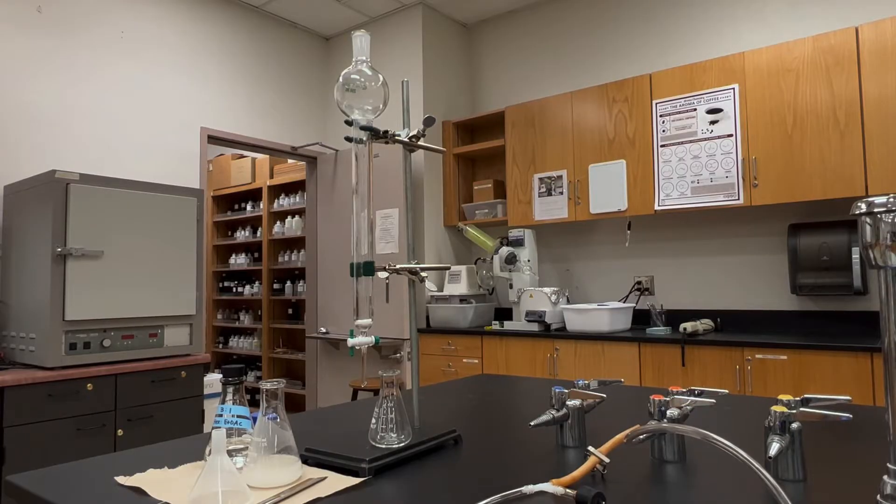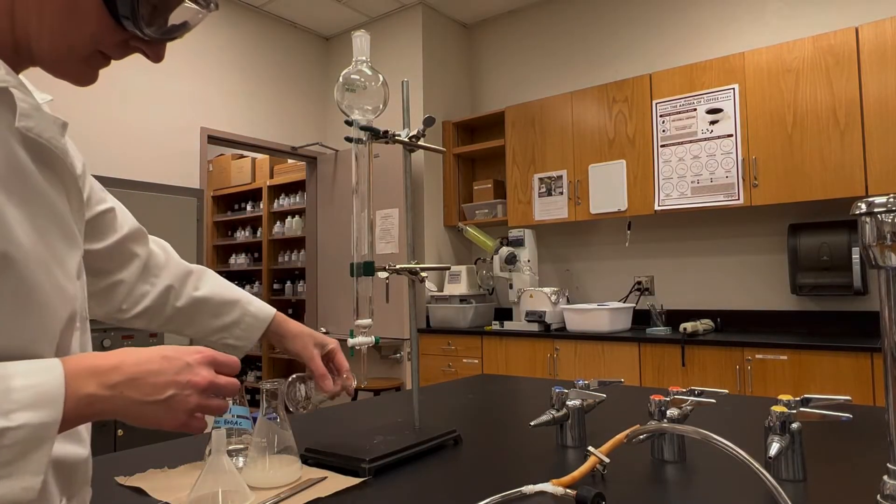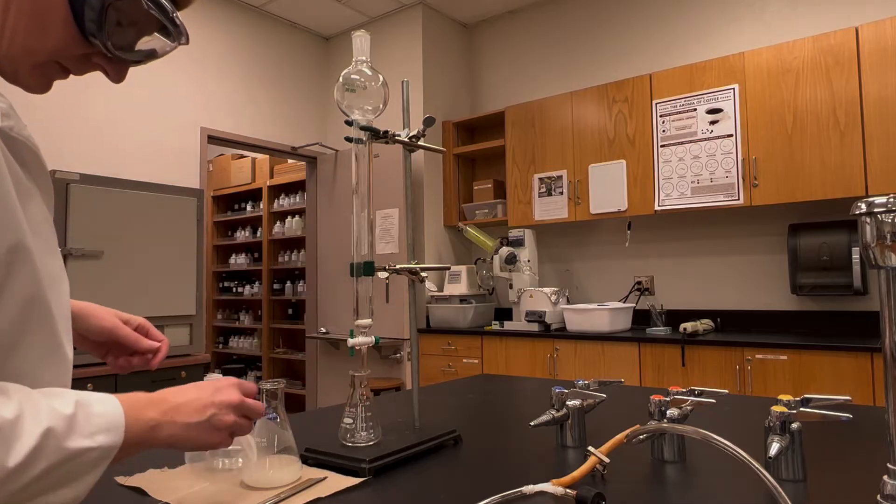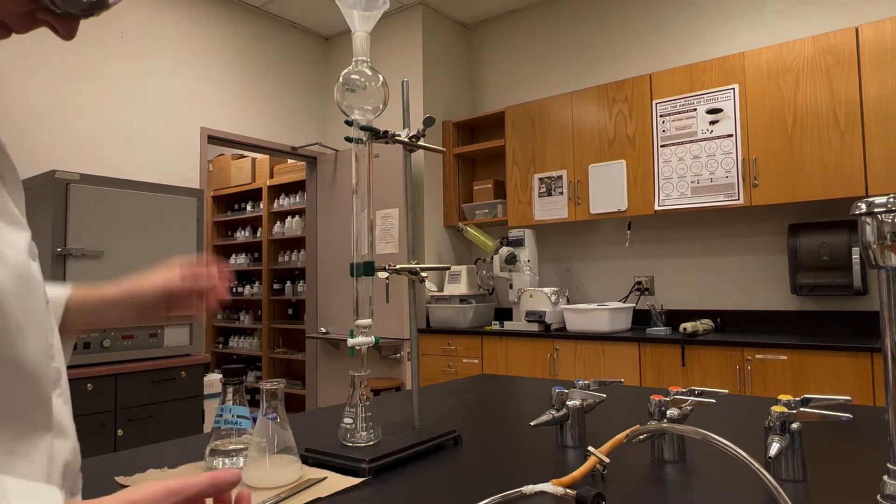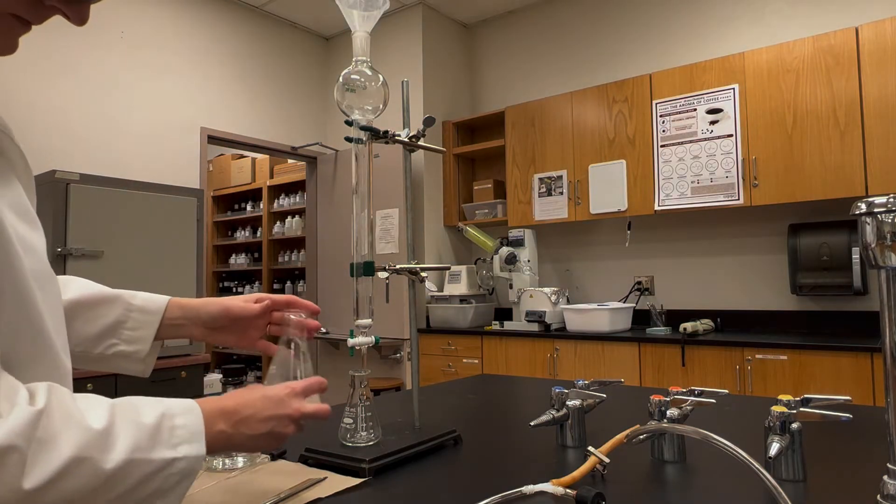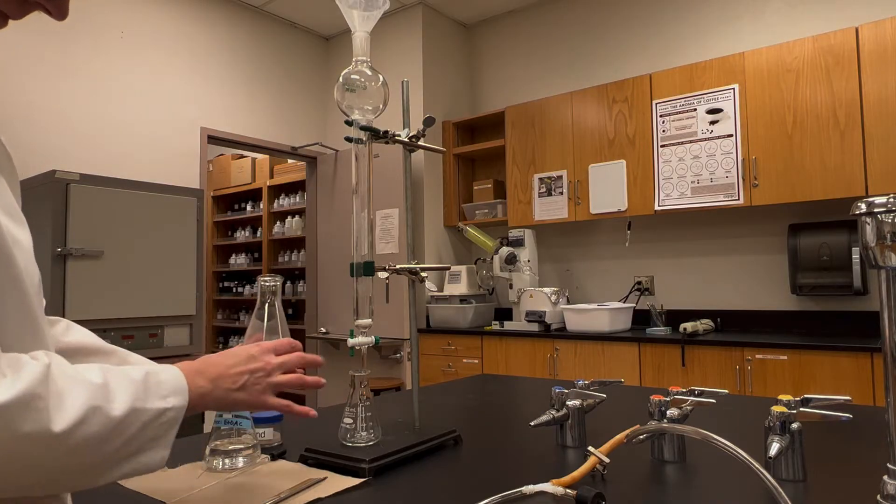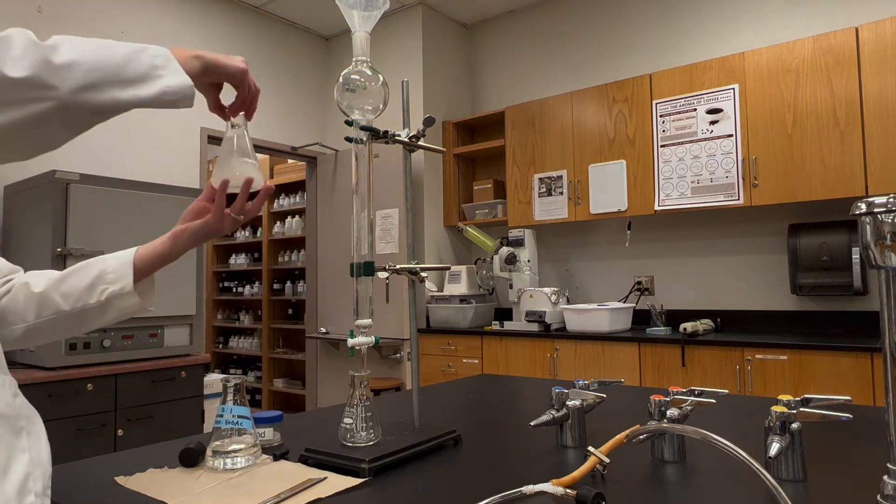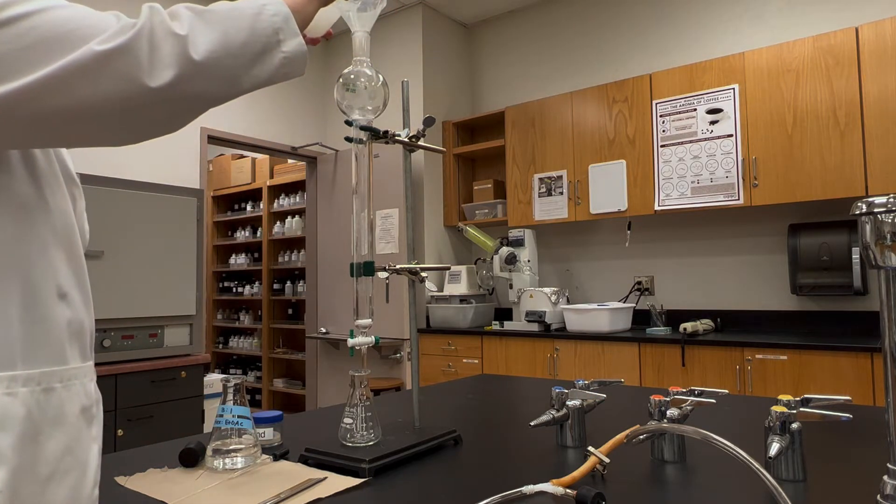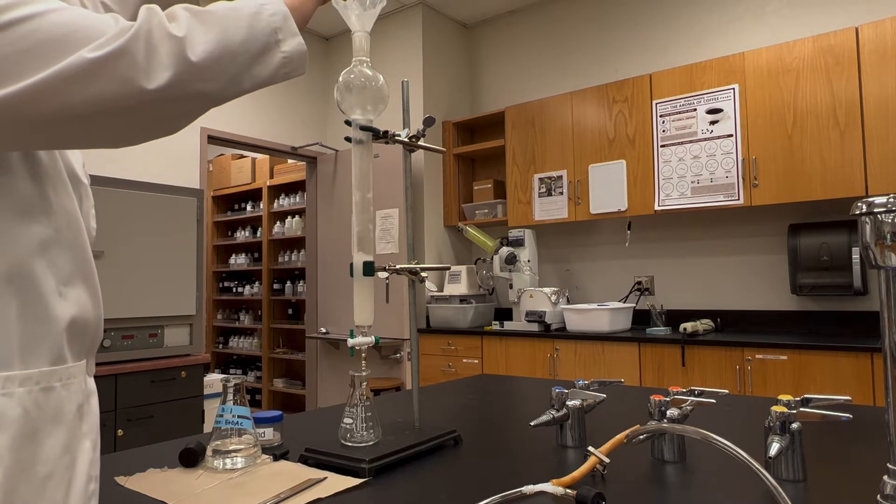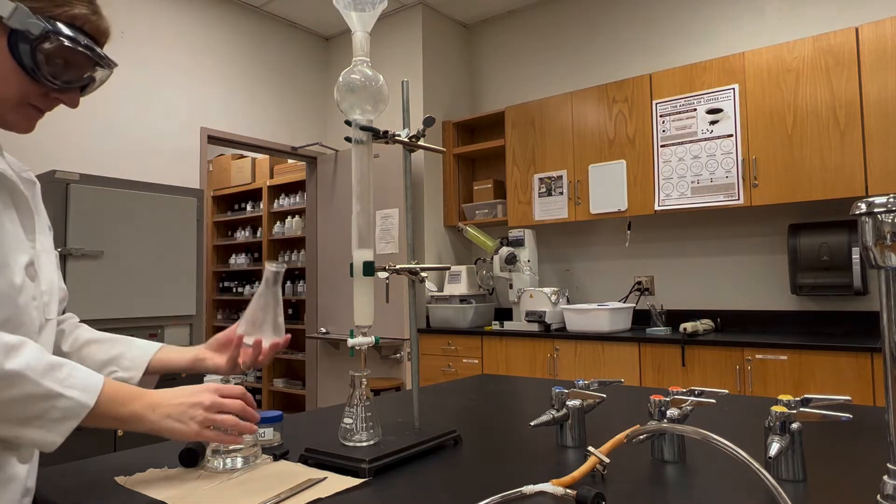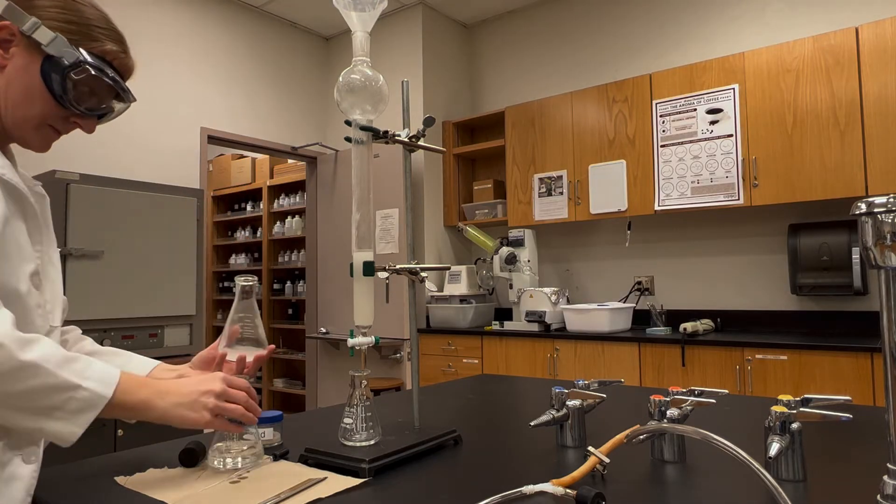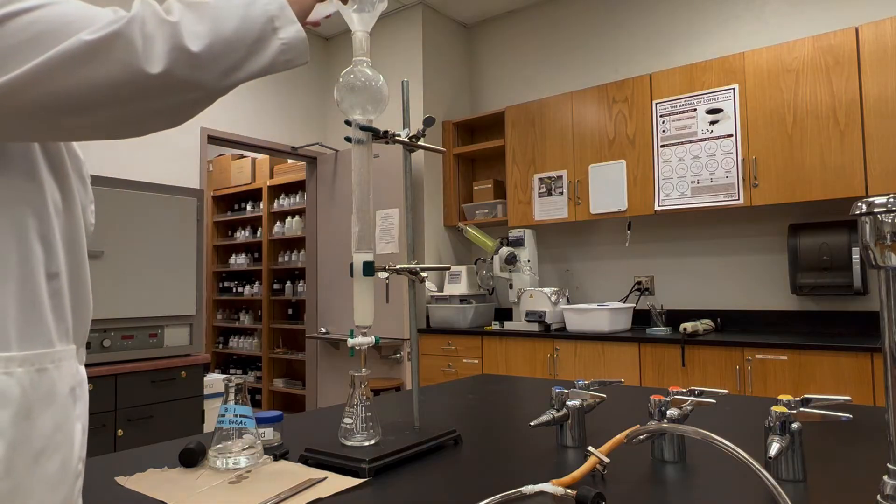If there isn't enough room to do the column in the fume hood once you've made the slurry mixture, you can bring it to your bench top. Put an Erlenmeyer flask underneath the column, have the stopcock open so that it can drain, and then through one of those wide-mouthed funnels pour the slurry mixture. Give it a swirl, give it a quick dump, and then follow it up with a small rinse of solvent to transfer more of it to the column.